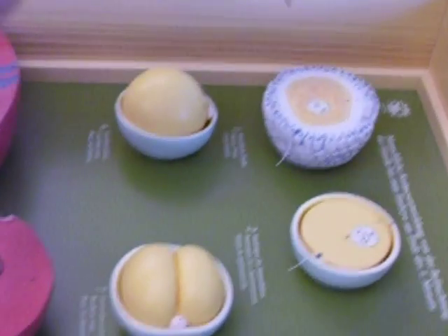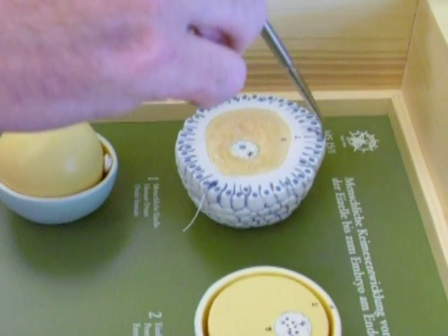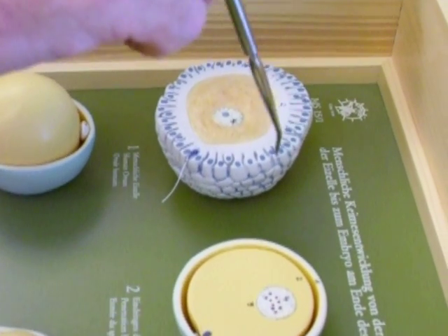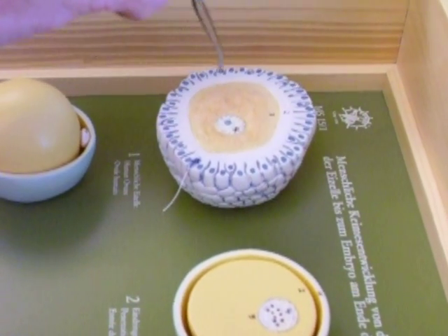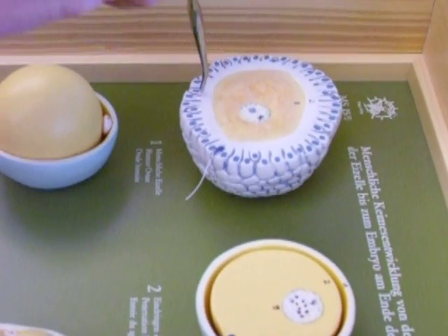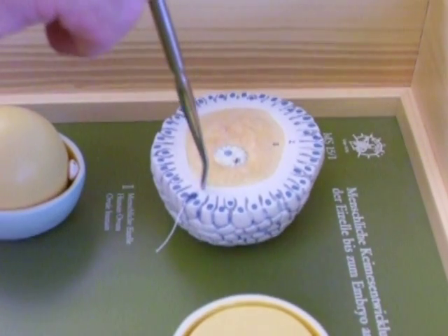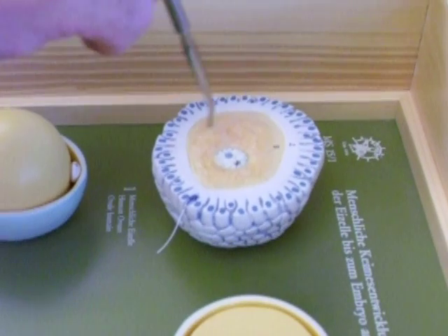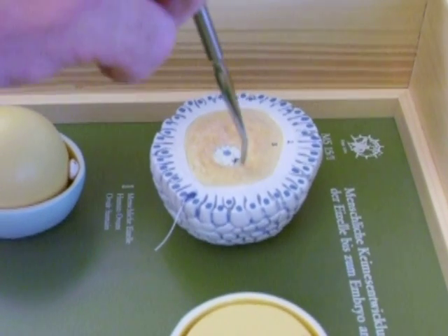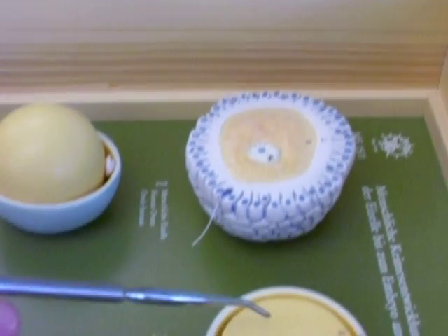All right, you can at the very least see this whole entire structure represents an ovulated egg. These individual cells make up the corona radiata. Those are the cells that were from the follicle. You also can see a band that goes around the egg itself, the zona pellucida. You see the egg or oocyte in it, and you can even see the nuclei of the oocyte in here.